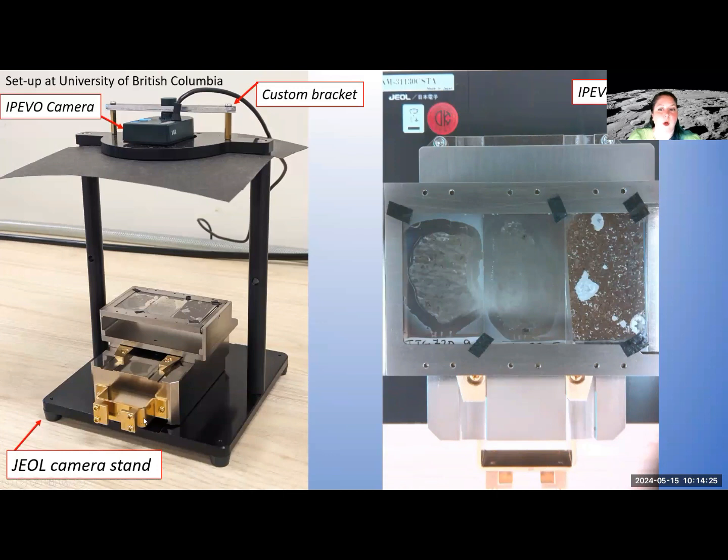And so the advantage is really it gives you a very nice picture. It's all aligned and there is no worry about a camera tilt or something. And that makes the pictures very reproducible. And I will show you how useful that is in the workflow later, having some kind of guide system for the holder and whatnot.